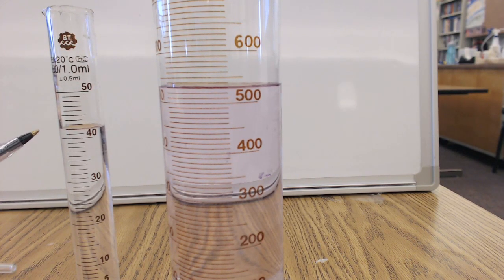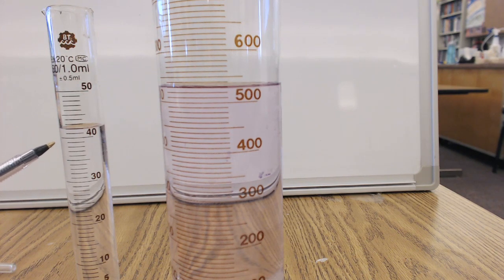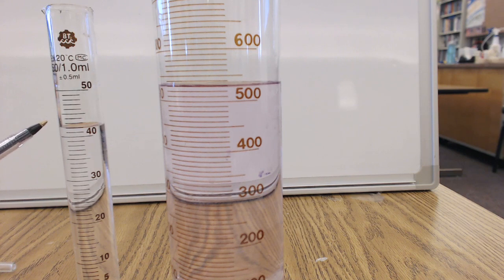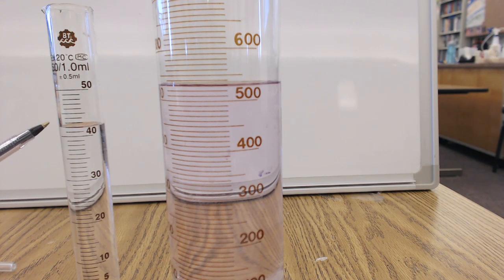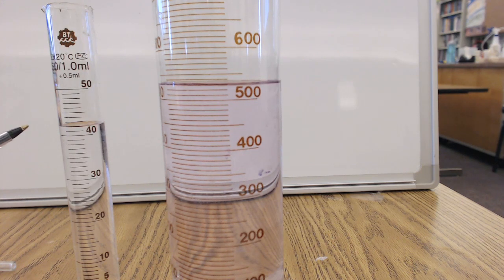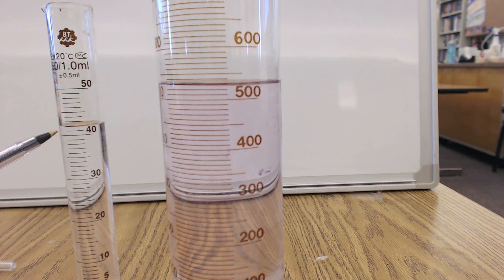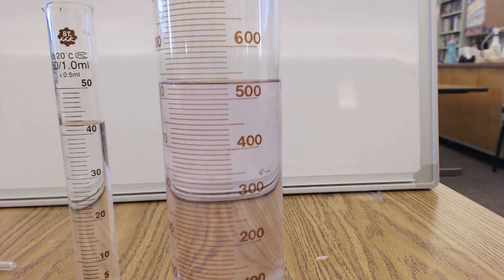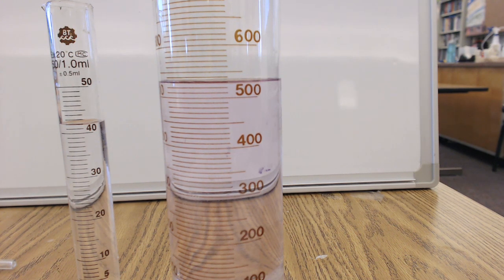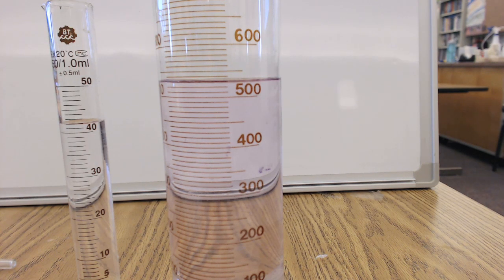So you can see on this first one, I know that it's above the 40 and below the 50. It looks like it's almost right on the 42. In fact, I think it's right on the 42. The bottom of the little bubble is called the meniscus, the bottom of the meniscus. So I think it's right on the 42. Is it exactly 42? No, you cannot have exactly a volume because A, you're using a piece of glassware that was made somewhere and isn't super accurate or precise. And so you're doing the best.